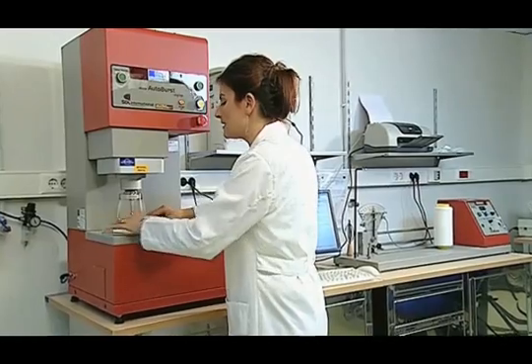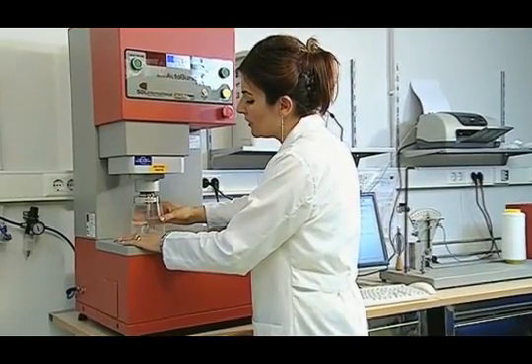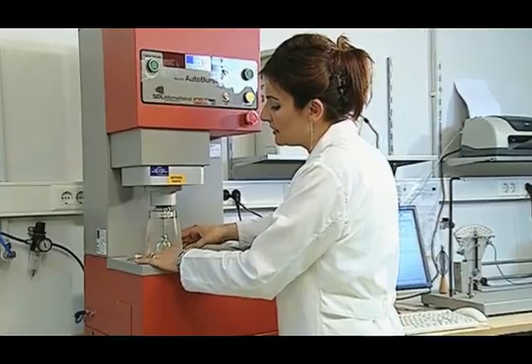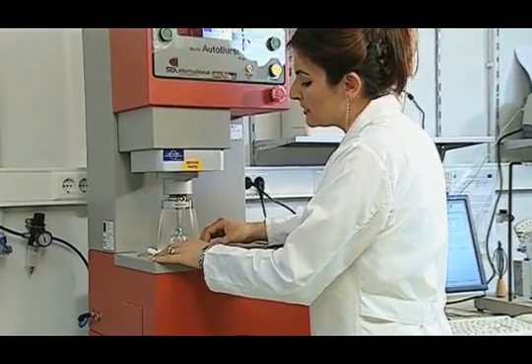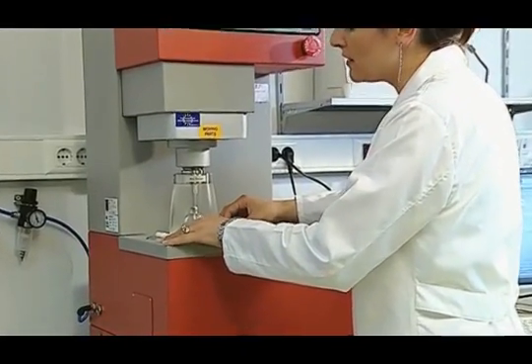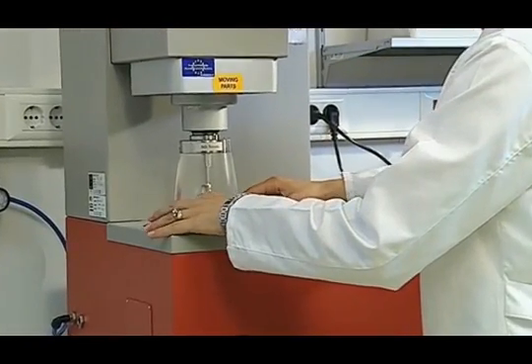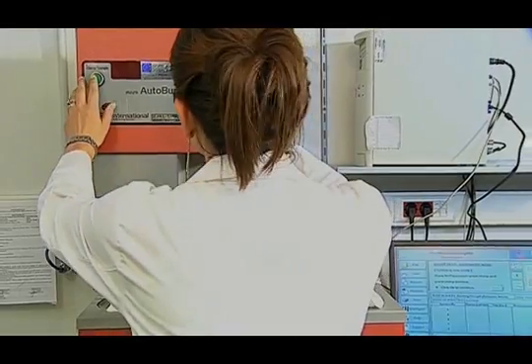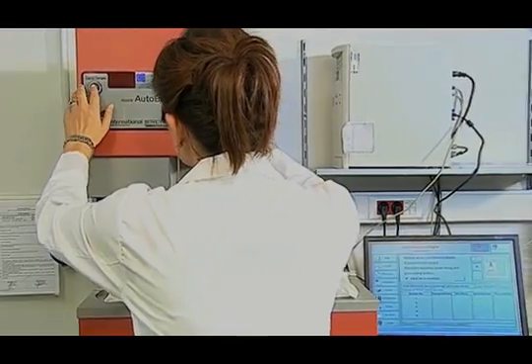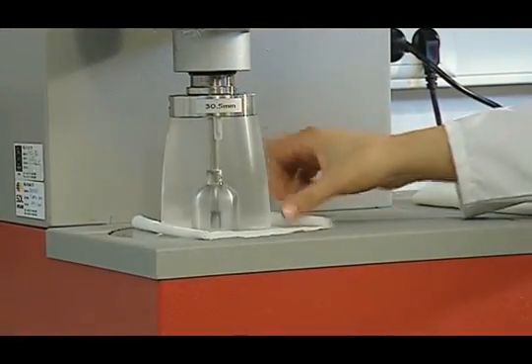We must make sure that the sample is not tight when placing it in the device. We pay attention to the fact that the bottom tray of the 7.3 square centimeters clutching device in the testing area is in the same area. By pressing two buttons at the top of the device, we make it clutch the sample between two plates.